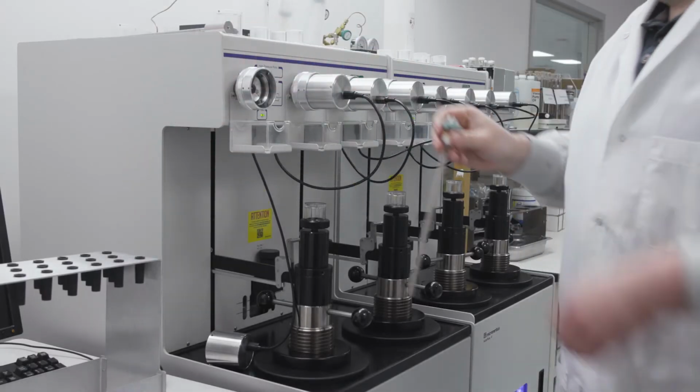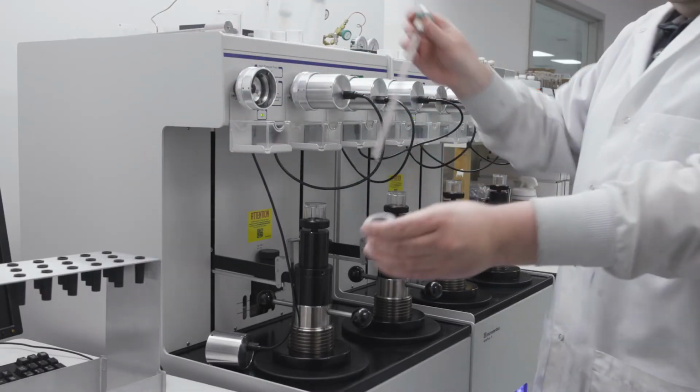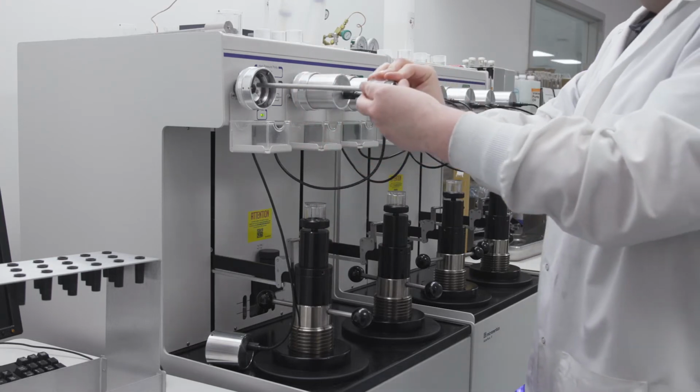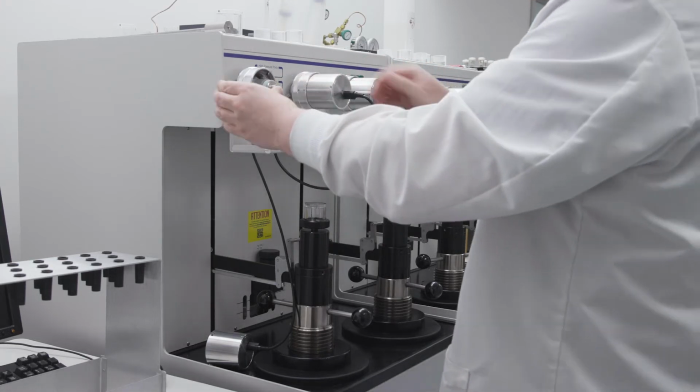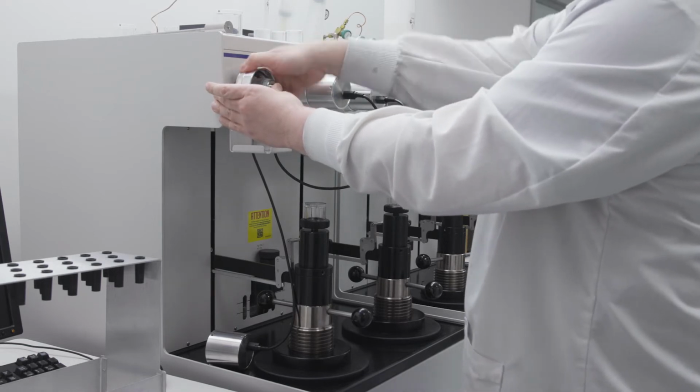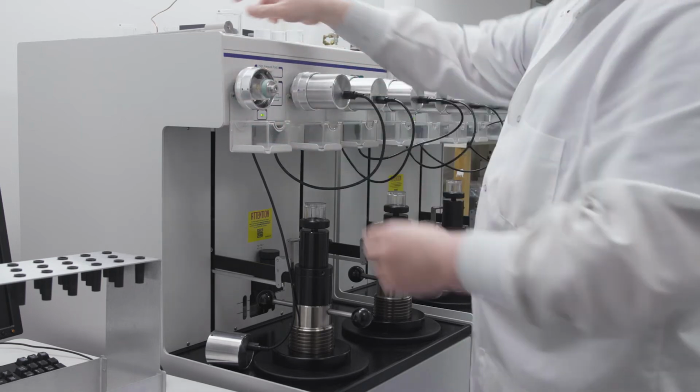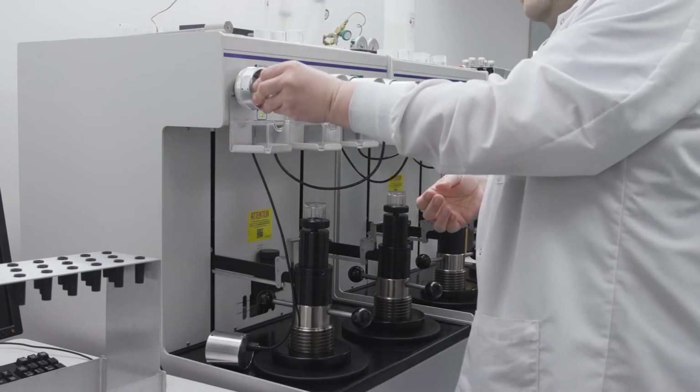Chris takes a sealed penetrometer, adds a spacer to make certain the penetrometer properly contacts the capacitance detector assembly, and carefully inserts the penetrometer in the port. He adds a transparent retainer and tightens the port around the penetrometer stem. He adds the detector assembly, and the sample is ready for analysis.